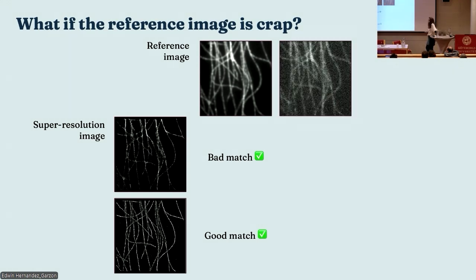But what if our reference image looks like that? Okay. SQUIRREL is not telling you anything about if your super resolution image is good. It's just telling you how well it matches to your reference image. So if your reference image is bad and your super resolution is bad, everything will say it's bad, but maybe not for the right reasons. And if your super resolution is actually quite good, but the reference is bad, SQUIRREL will tell you it's bad when it's actually good, okay? So I spent a lot of time thinking, well, how can we legislate for this? How can we legislate for the fact that someone might put in a slightly dodgy reference image?